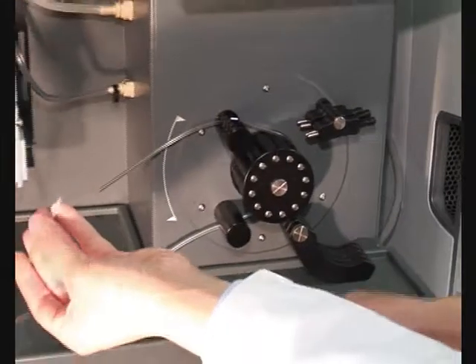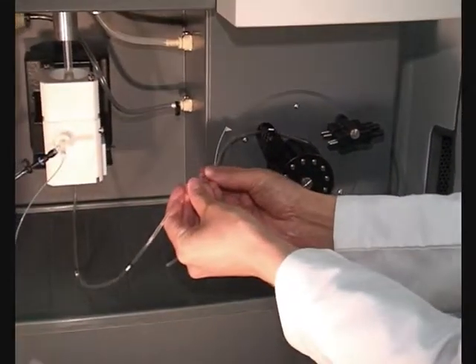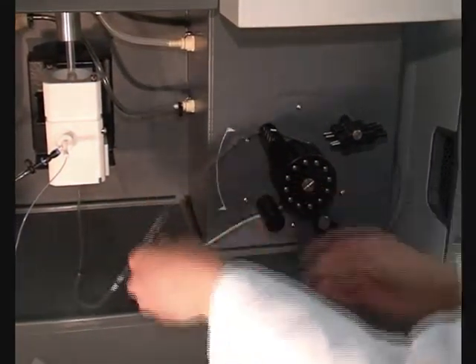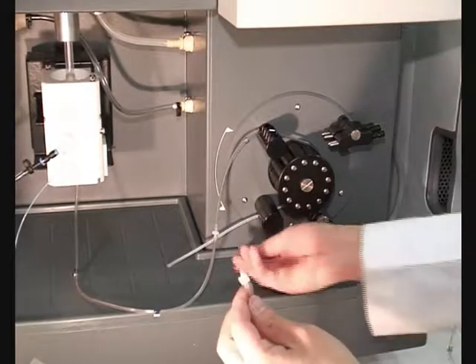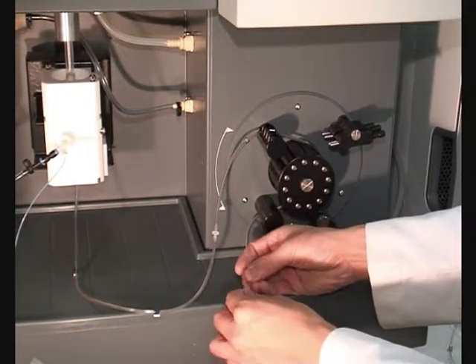The upper end of the drain pump tubing leads to the bottom of the spray chamber. The lower end of the drain tubing leads to the drain vessel.